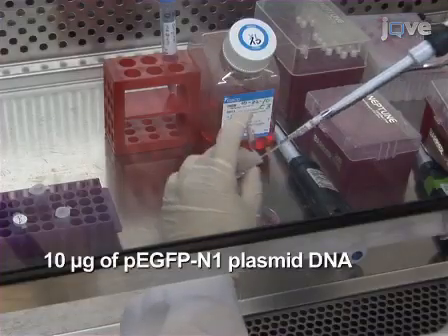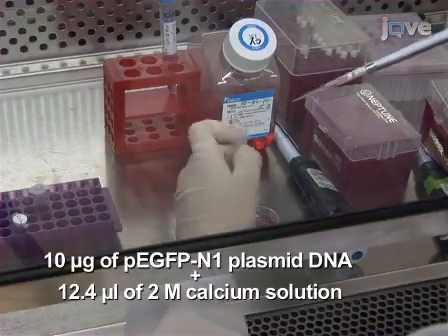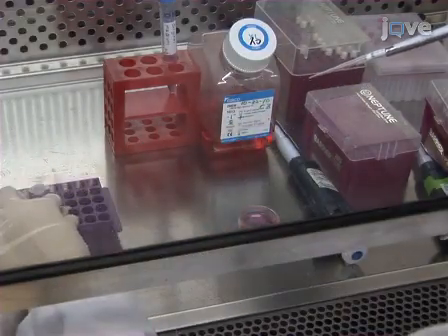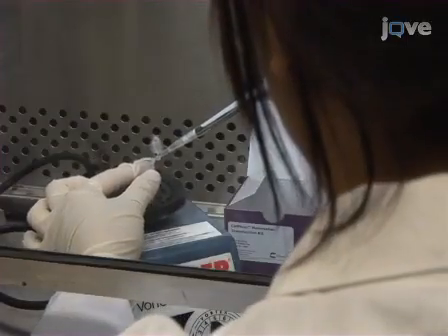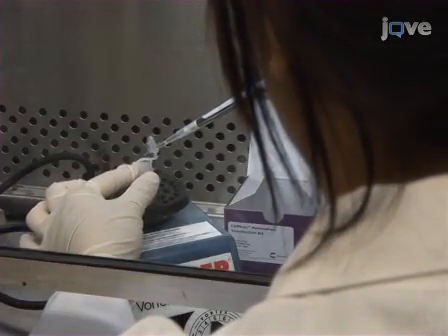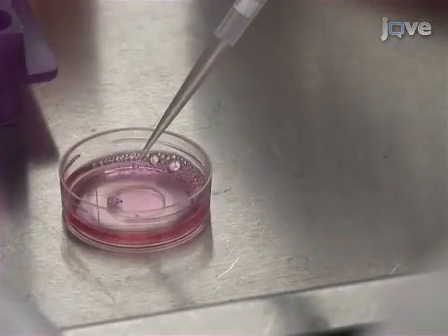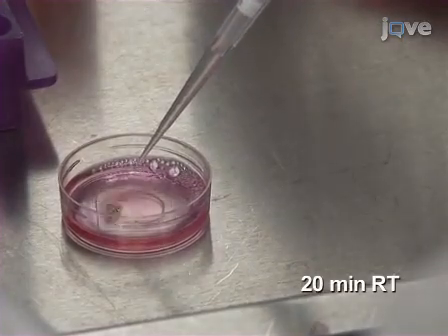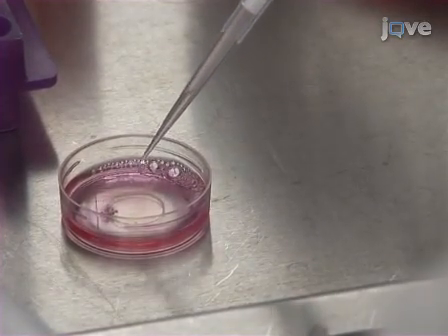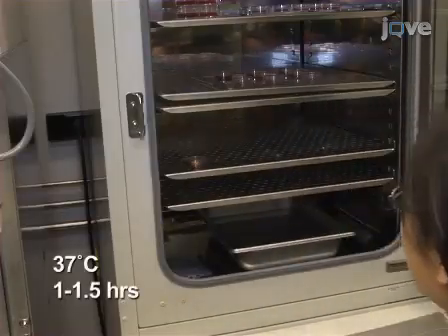Next, combine 10 micrograms of pEGFP-N1 plasmid DNA with 12.4 microliters of 2 molar calcium solution and bring the total volume up to 100 microliters with sterile water. Add the DNA mixture dropwise to 100 microliters of 2x HEPES buffered saline, vortexing the buffer after each drop is added. After letting the final mixture sit at room temperature for 20 minutes, add the buffered DNA solution to the DMEM incubated neurons. Incubate the neurons at 37 degrees Celsius for 1 to 1.5 hours.